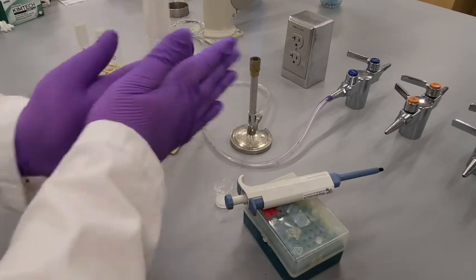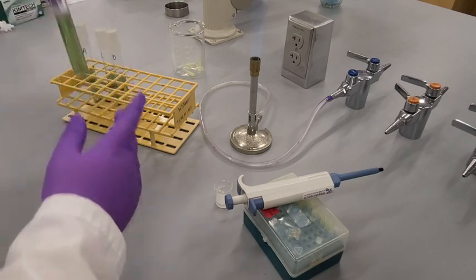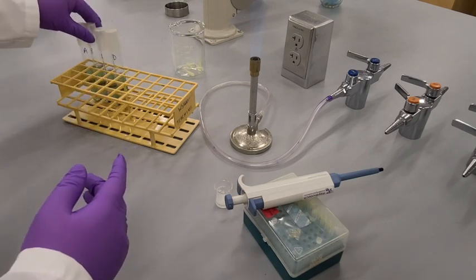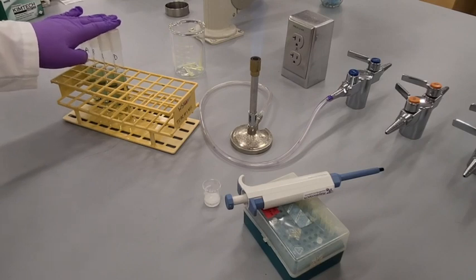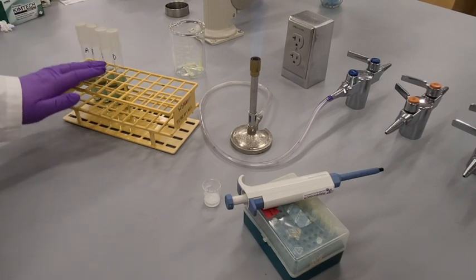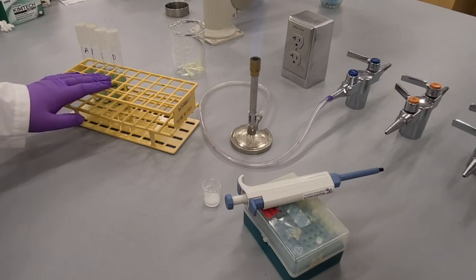And then when this cools the agar will solidify. So now that I've inoculated all three of my test tubes, I'm going to incubate these over the next 72 hours and we're going to check back every 24 hours with that day's results to see where we're at.